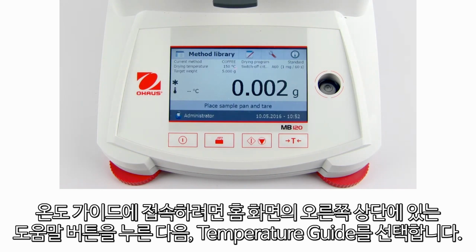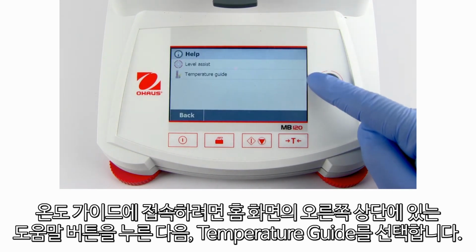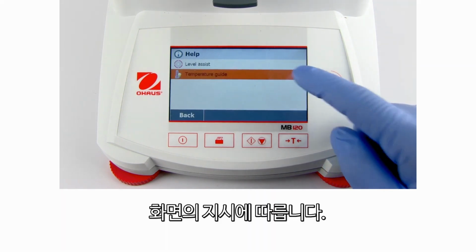To access the temperature guide, press the Help button in the upper right-hand corner of the home screen and select Temperature Guide. Follow instructions on the screen.